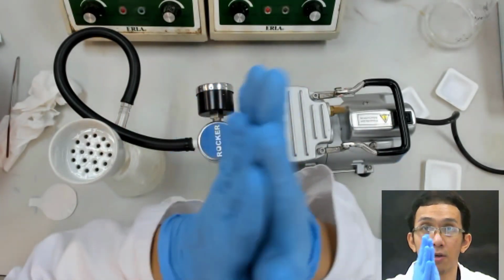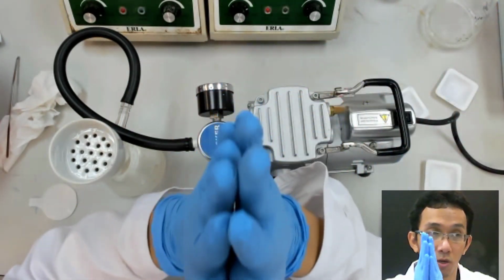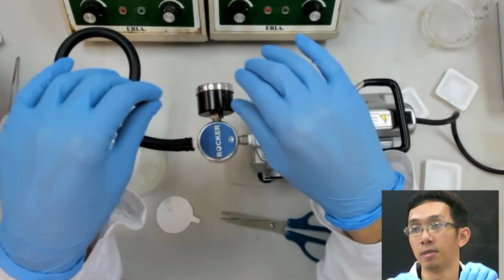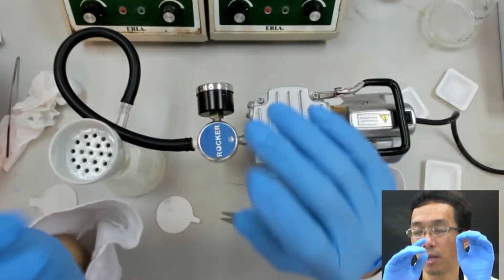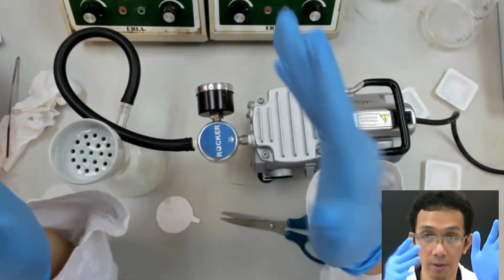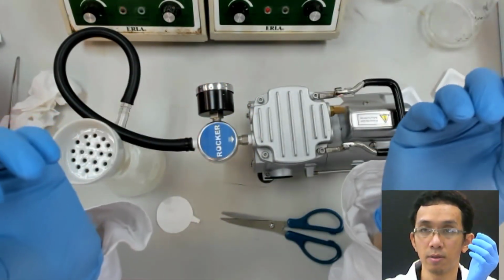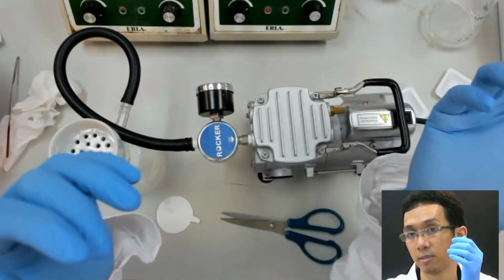No? Okay. So make your lab report based on the experiment that you just saw. For melting point, you know what to do. For the recrystallization, come up with your own numbers and then discuss.